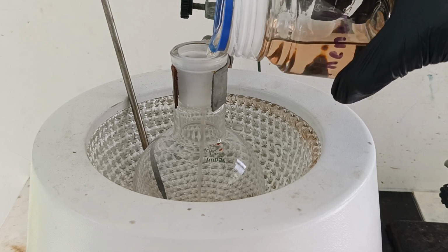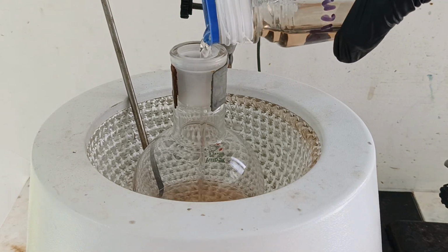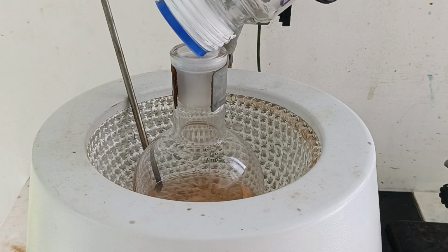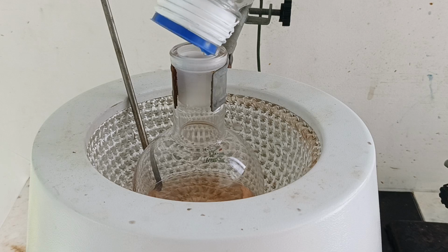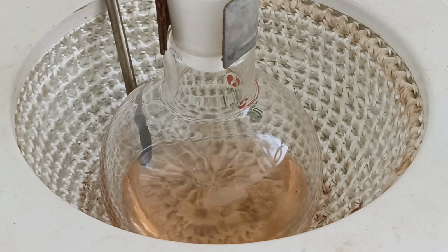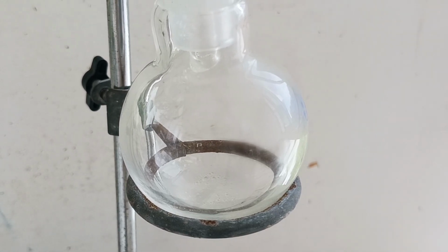I get all the phenol into a clean round bottom flask, and then set up another short path distillation. You may notice that the phenol took on a light pink color during storage. I don't know why this happened, and it's probably some impurity which got oxidized. You may also have noticed that the phenol was liquid when I poured it into the flask. Normally phenol is a solid at room temperature, but this time it was a liquid. This means that there's still a bunch of water present, which is preventing the phenol from crystallizing. That's fine though, because distilling it again is going to remove the water.